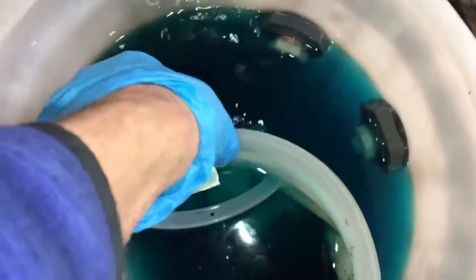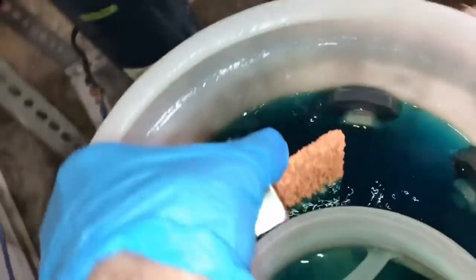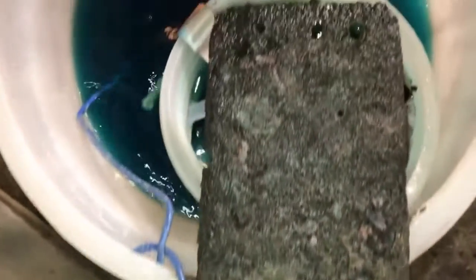So we're about 200 hours in and I can't wait to try that smooth plate experiment. Look at how beautiful this thick, smooth layer of copper is coming out. We can make the whole thing look like this if the plate stays smooth and we keep our additives right. This is not going to be pure copper because of the mechanical entrainment caused by these crystals — that's why you want to avoid those. The cathode has to be turned into an anode anyway. The anode is severely devastated at this point — entire regions flaking off at the slightest touch. We're still running at about 4 amps of power.